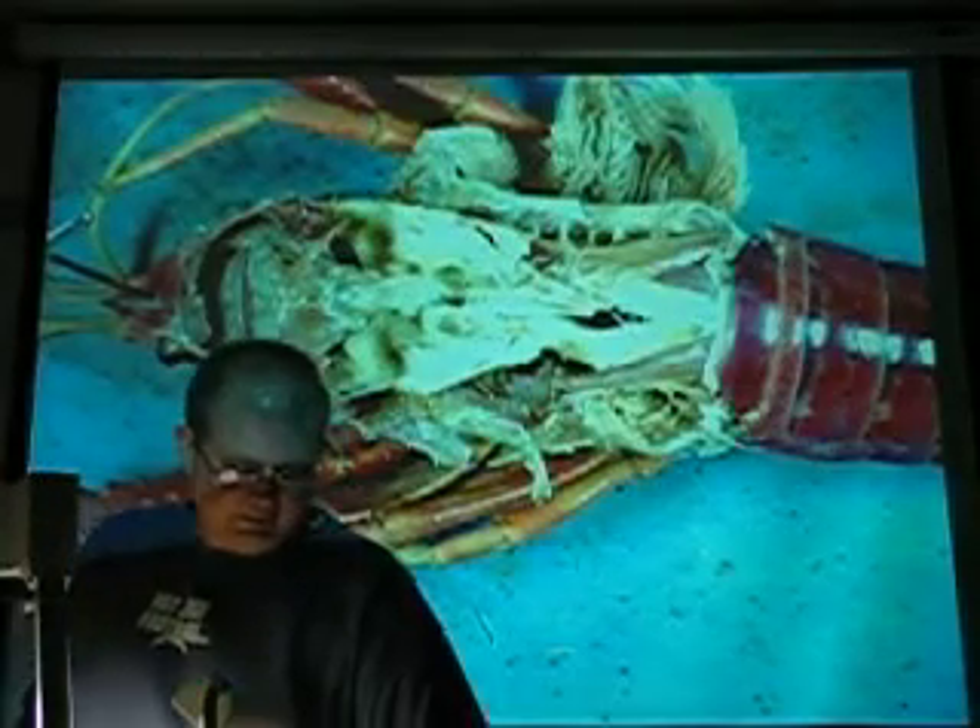Posterior muscle. Gastric muscle. It's in the book. Where's the key? Gastric T. I'll get there. See, I'm not afraid to use a billion pens. What I just did was called a radical gastrectomy.